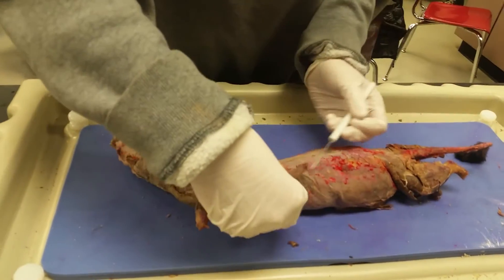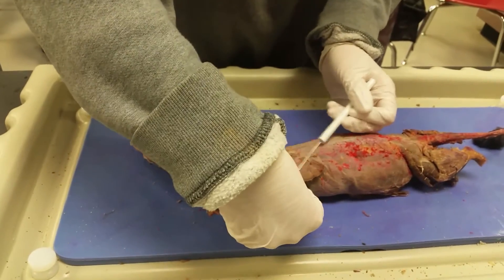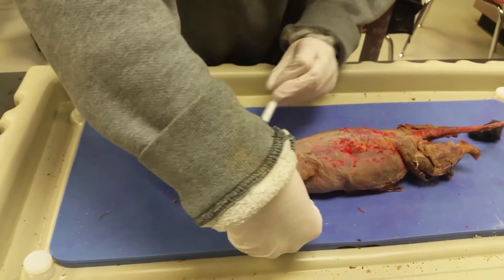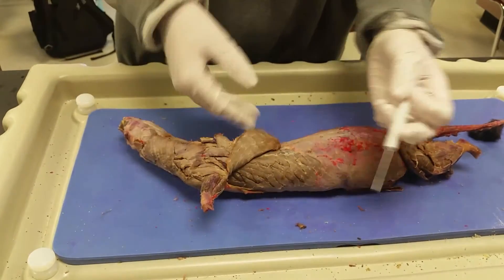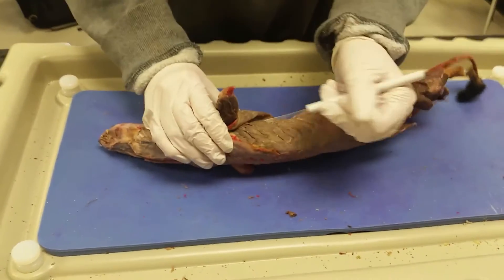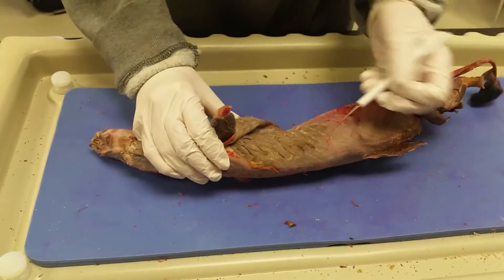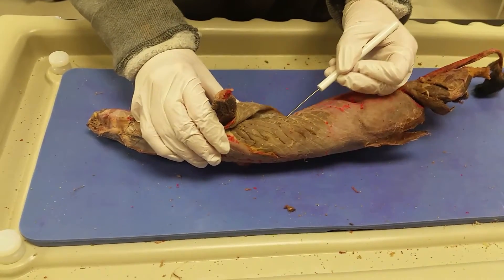As you can see, we have dissected out the latissimus dorsi. Underneath the latissimus dorsi is the interweavings of the serratus ventralis.